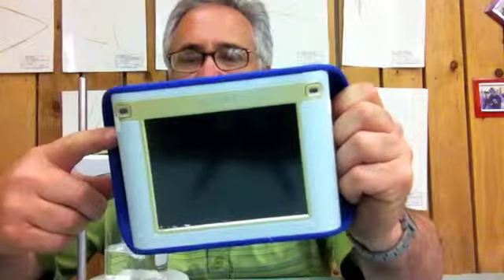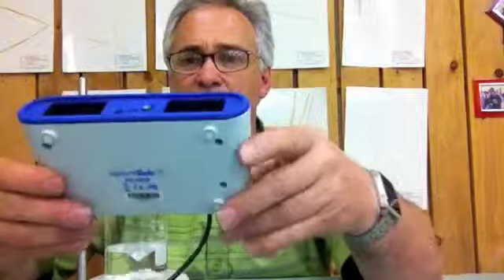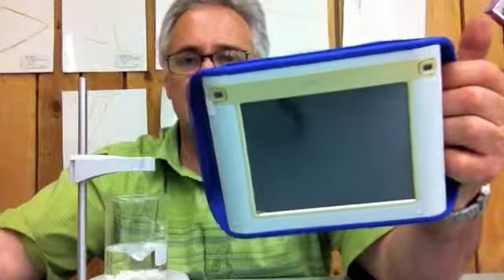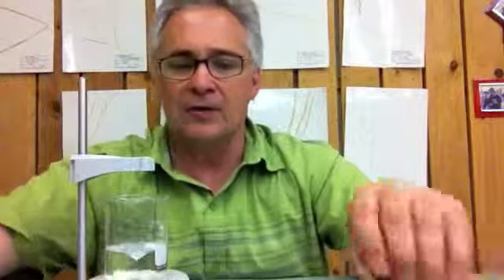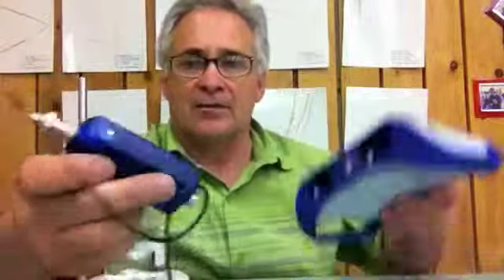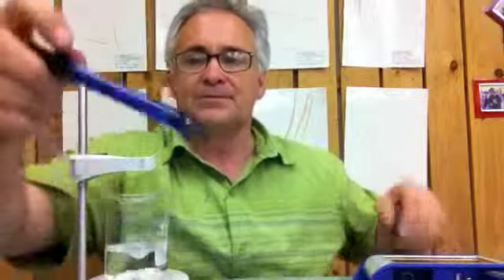This one's much more flexible on where you're going to be sitting in the lab, whereas this one's kind of tied to the computer, but it does have the advantage that it's a little faster, you can save it easier, and of course you can print right from your computer. This one saves as well as prints, but it's not quite as easy to make that happen. But you decide, it's up to you. I'm going to go ahead and use the handheld data logger. We'll take the handheld data logger, take the amplifier box, connect it inside the port, and now we're ready.